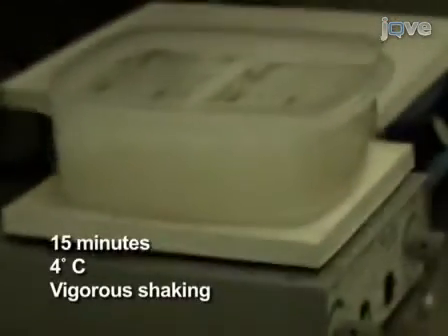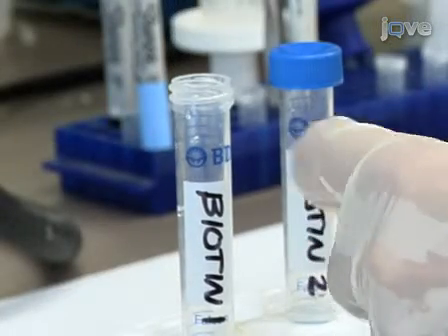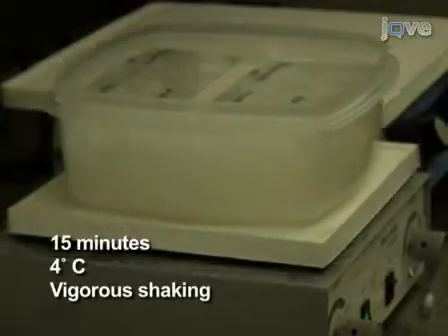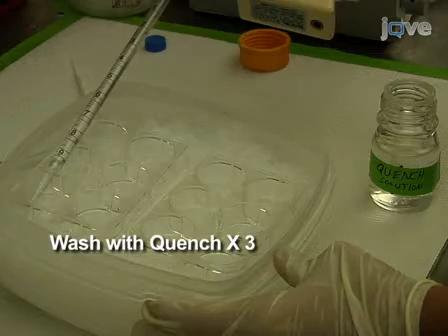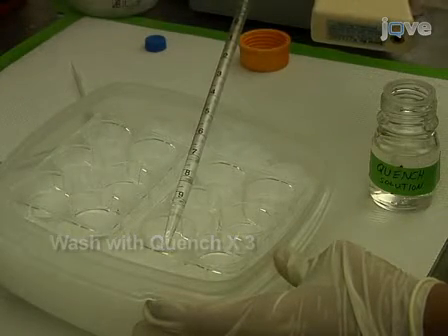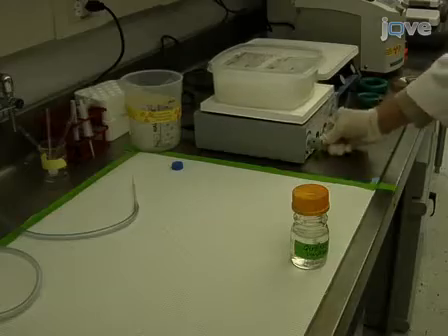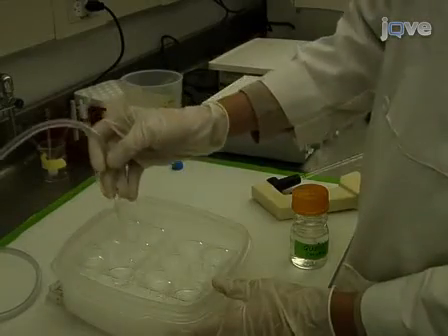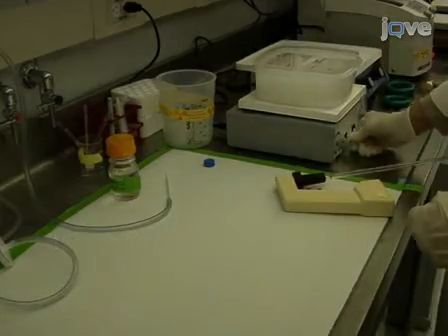Incubate for 15 minutes at 4 degrees Celsius on the ice bath with vigorous shaking on a platform shaker. Just prior to the end of the incubation, prepare another fresh sulfo-NHS-SS biotin solution, and at 15 minutes replace the old solution with the fresh solution. Incubate for an additional 15 minutes at 4 degrees Celsius with vigorous shaking. After the second incubation, wash cells three times quickly with 2 milliliters of quenching solution, then incubate in 2 milliliters of quenching solution for 15 minutes. Replace with fresh quenching solution and incubate an additional 15 minutes, keeping plates at 4 degrees Celsius with gentle shaking.